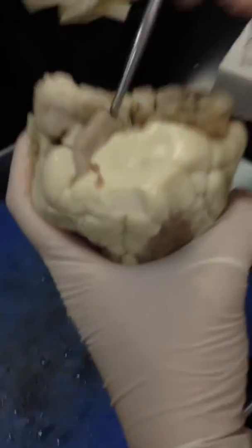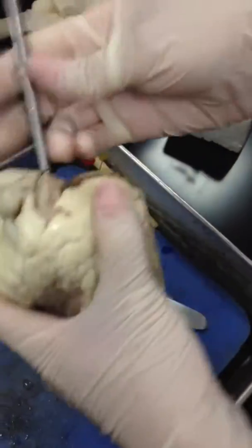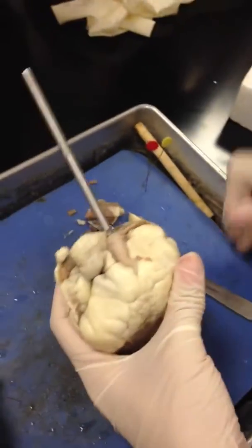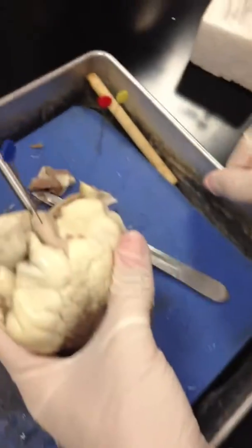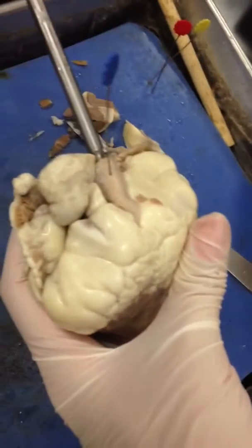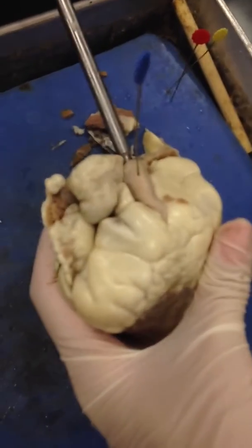From outside we can see — what vessel is that? The pulmonary trunk.